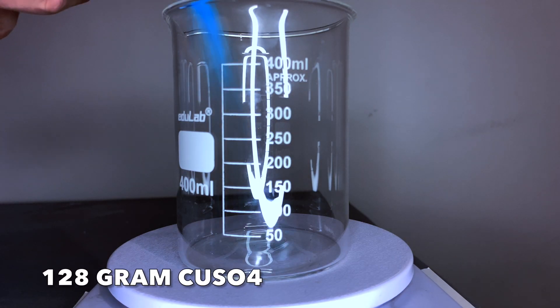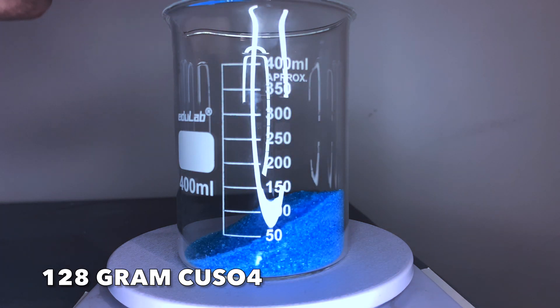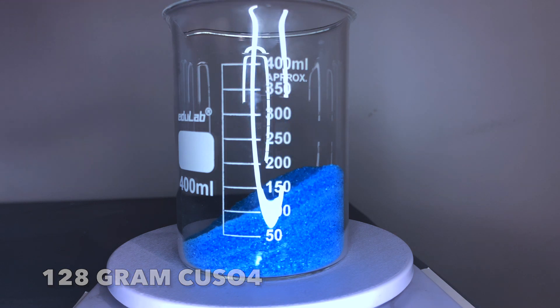First, I am adding 128 gram copper sulfate. Also, copper sulfate salts are used in agriculture.